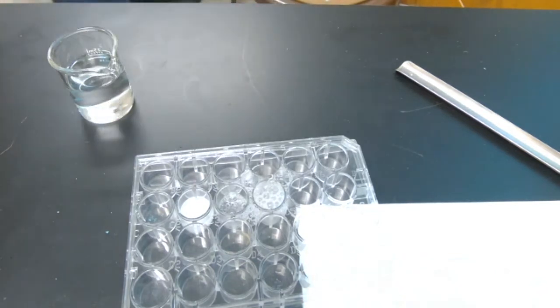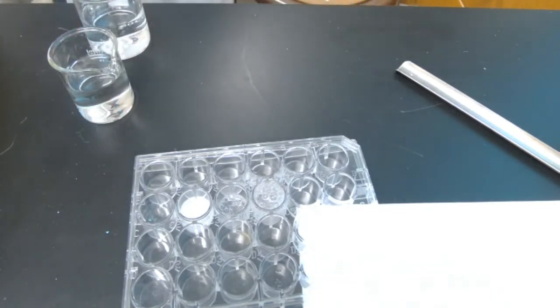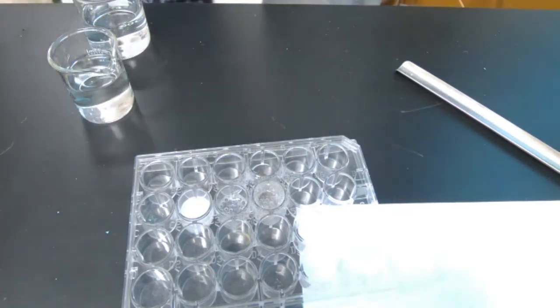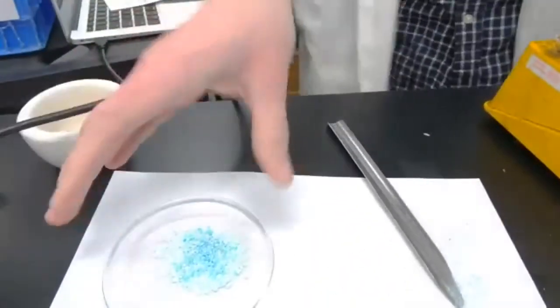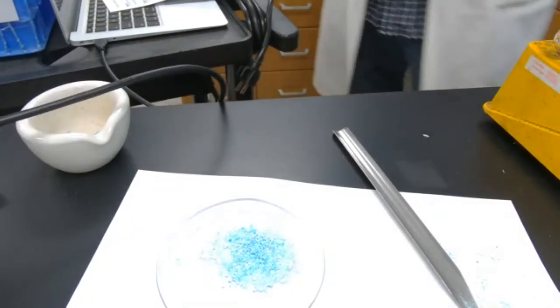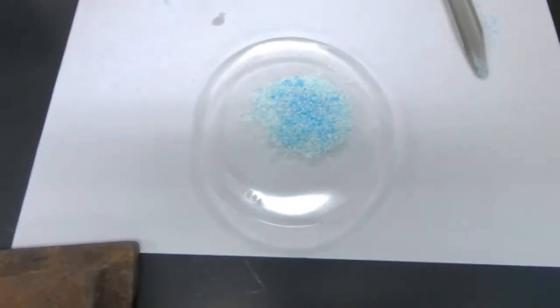For the next little tidbit, I just need to go back and get some water. That was station number 6 that you see in that well plate. And then I'm going back to station 5 because that evaporating dish needed to cool down a little bit. To be honest with you, it's not that cold, but I also want to wrap this up for you. So I'm going to transition back over here with my glass. Let me pull you in a bit closer. And it says to add water to this.